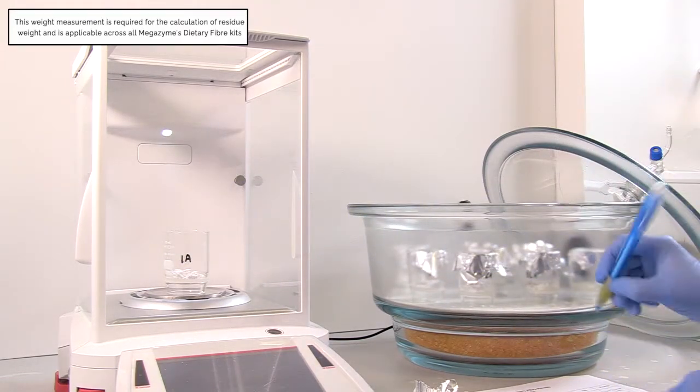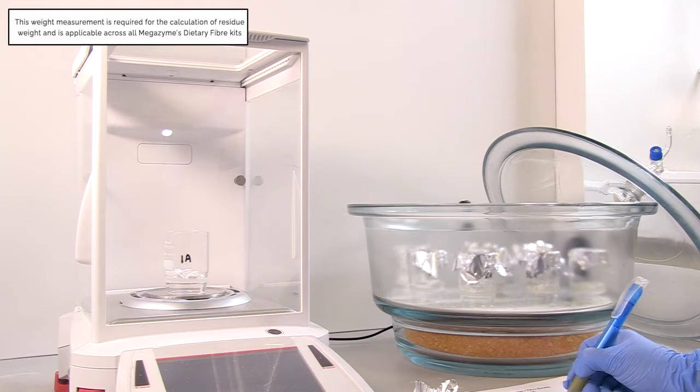This process is applicable across all of Megazyme's dietary fiber assay kits.